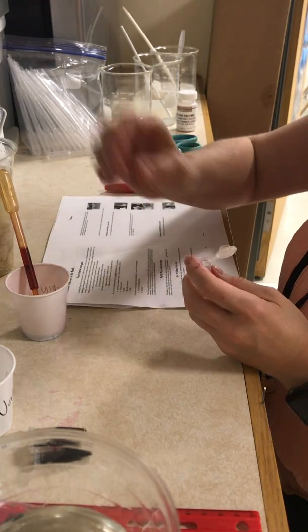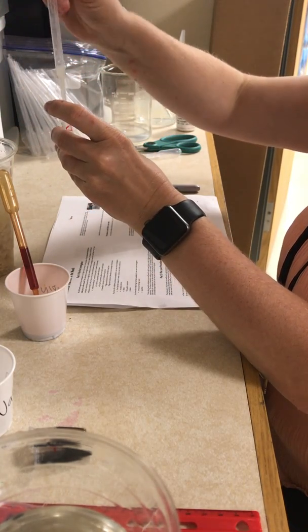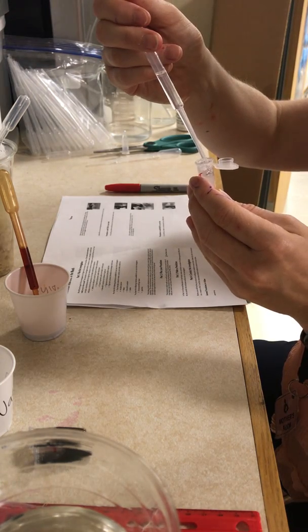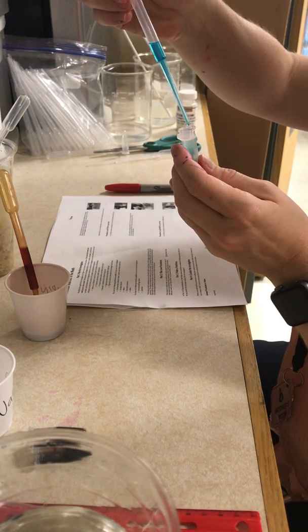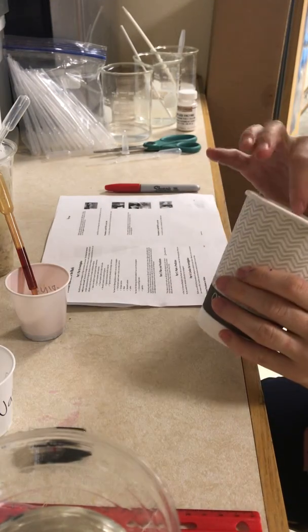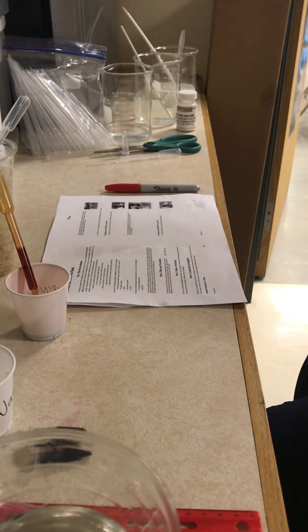My last tube, tube D — I'm going to start by adding my food sample, which is cracker, and add it to the tube. Next, instead of water, I'm going to add amylase. Then I'm going to add five drops, or 0.5 milliliters, of Benedict's. Since this has Benedict's in it, we need to heat it up. I'm going to take near-boiling water from a tea kettle or electric water heater, and pour it in on top of my tubes. Let that sit for five to ten minutes.